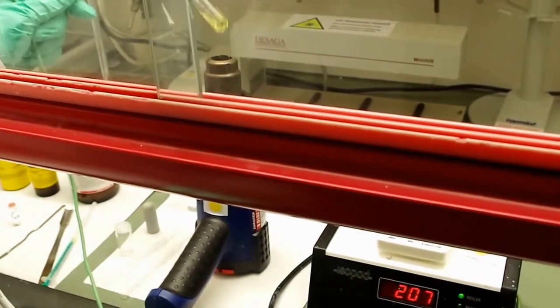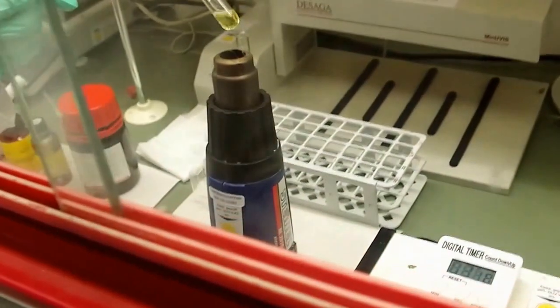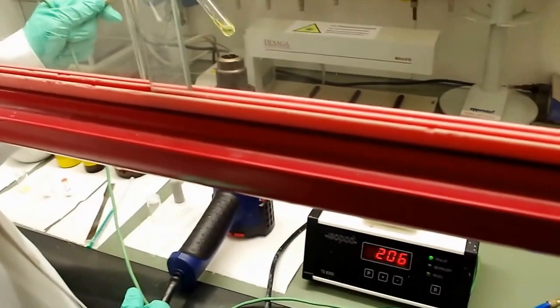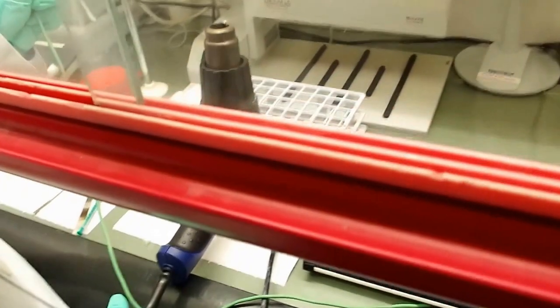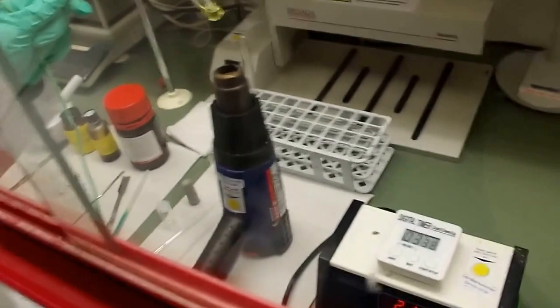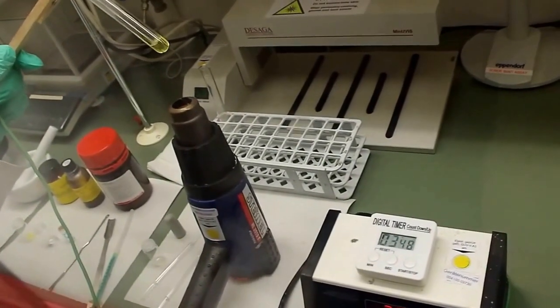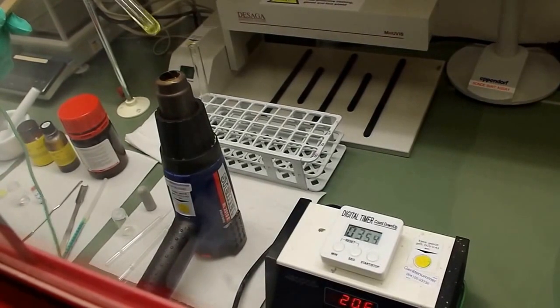Okay, 3 minutes over. I try to control the temperature.